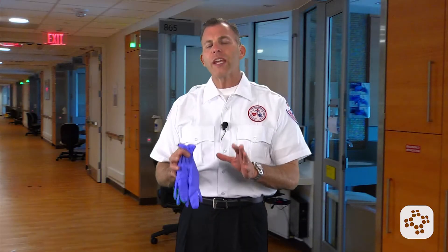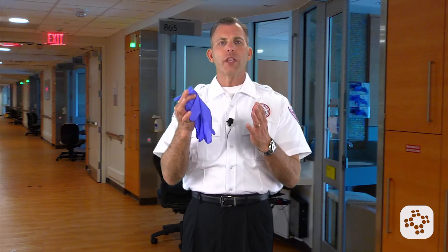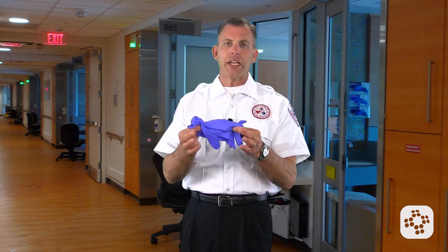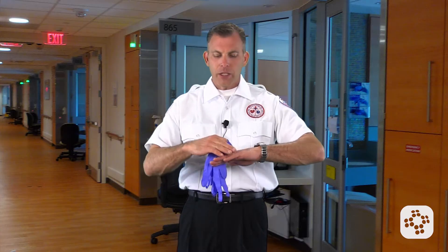It's important to understand the proper donning and removal of personal protective equipment — in this case, gloves. Our gloves are our next line of skin to help prevent any type of contamination into cuts and scrapes. The hands are so easily abraded.